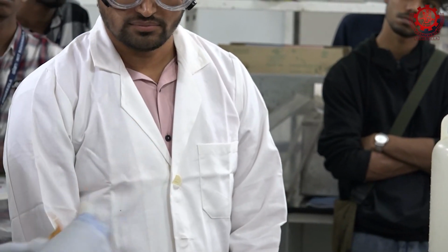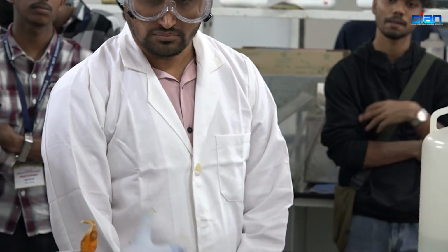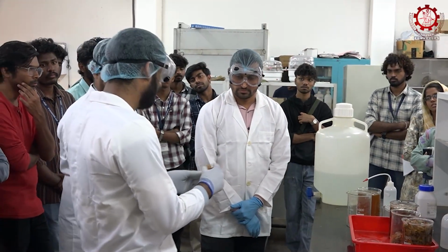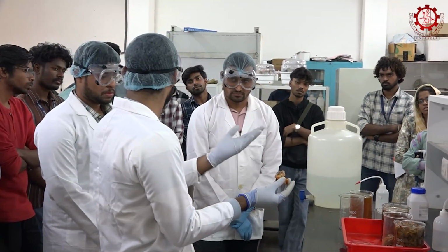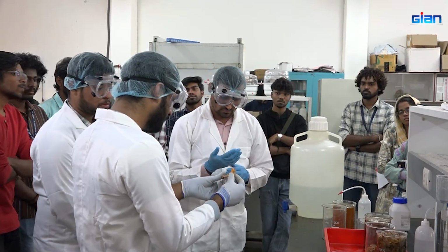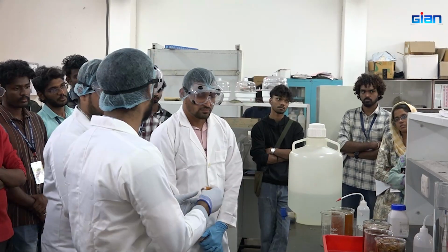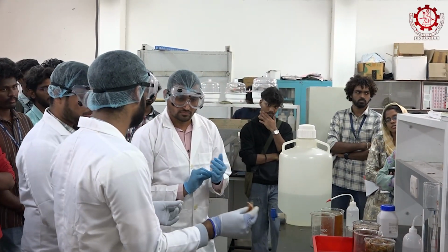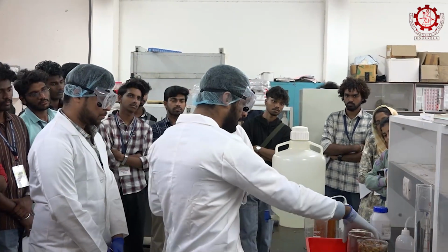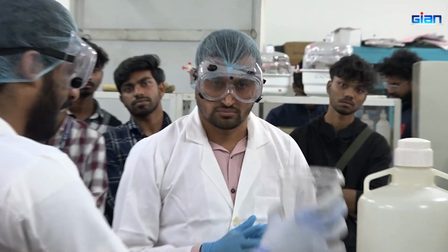This is because of demineralization. Most of the calcium carbonate reacts with the hydrochloric acid and forms calcium chloride and carbon dioxide, which, as we saw yesterday, was being released in between. So this is the demineralized crab shell. Now we are going for deproteinization, but before that we have to wash it. As we already have washing solution, I have partially washed this, so that's why it looks somewhat better than these samples.